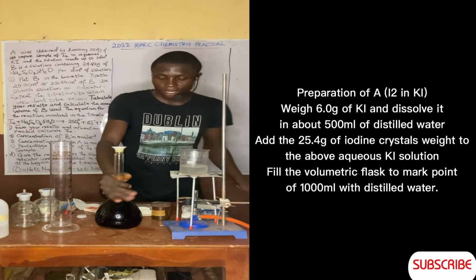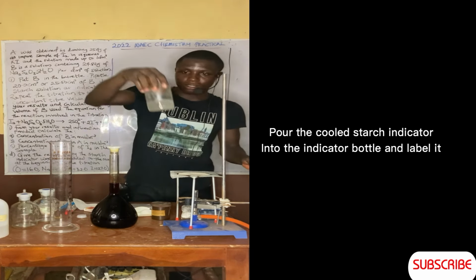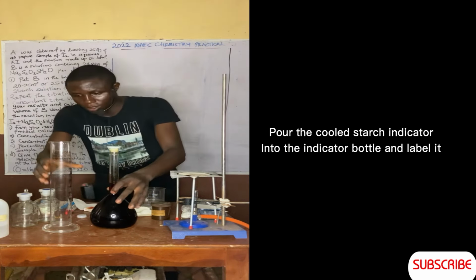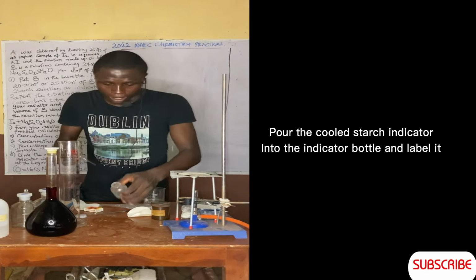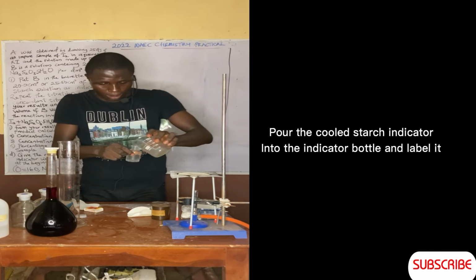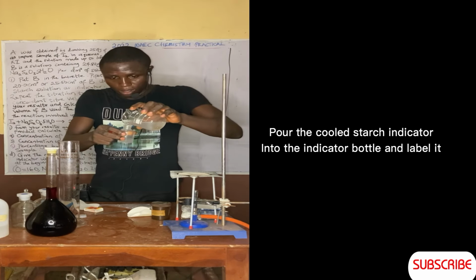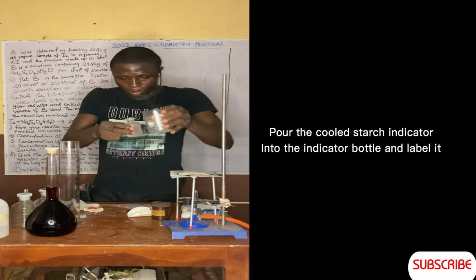So now we have to measure this. Now let's carry out titration. These are being cooled. So you pour it inside your indicator. Pour this inside your indicator here. This is your indicator bottle here. Let's mix it. So I'm pouring this now, while I keep the rest.